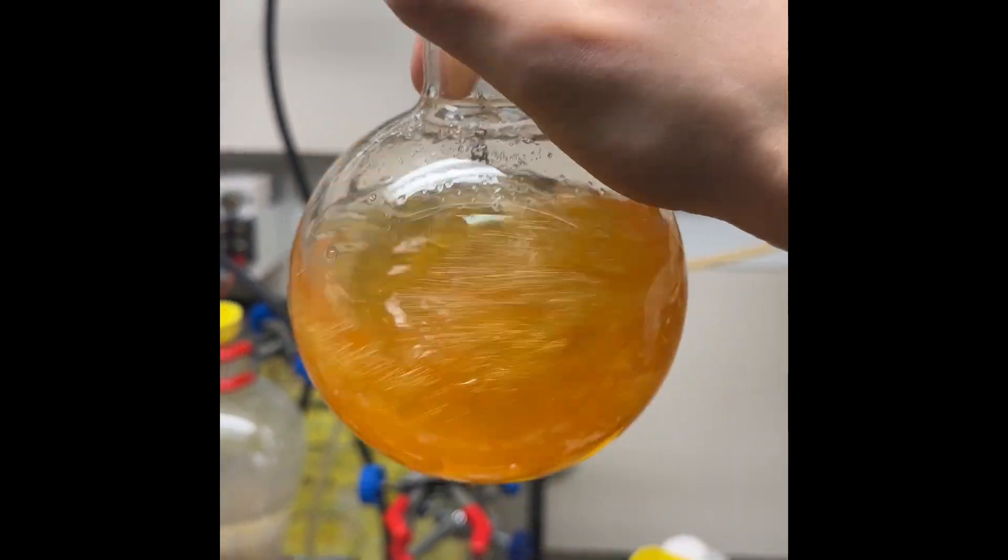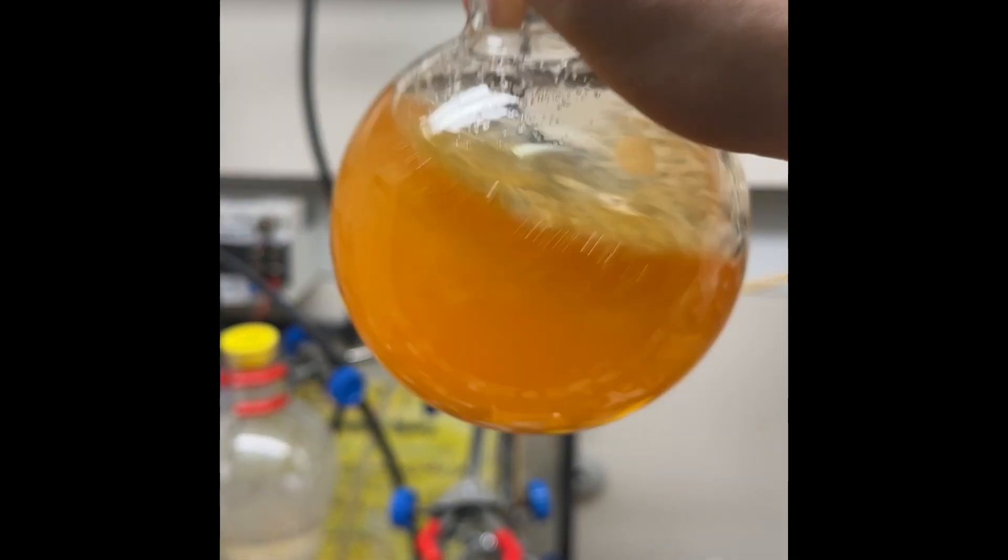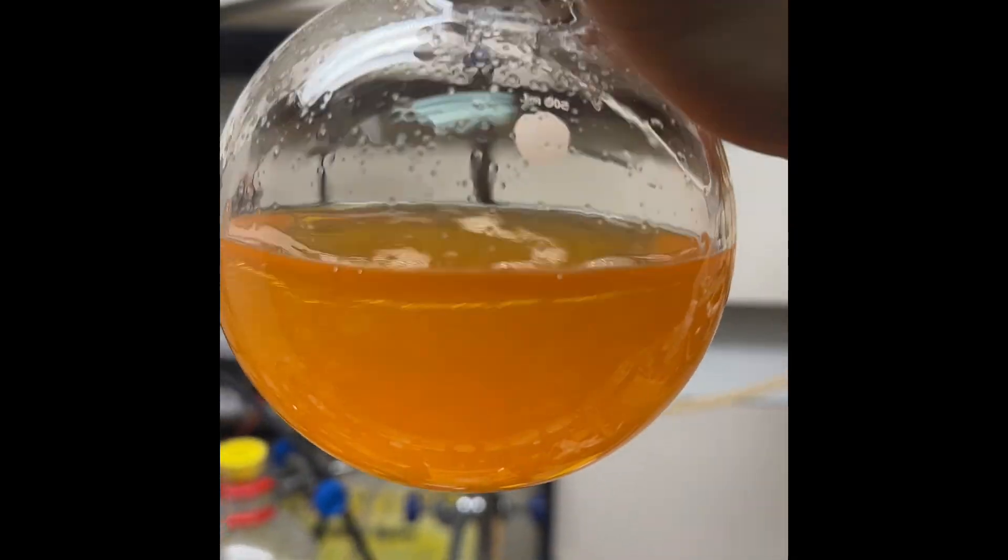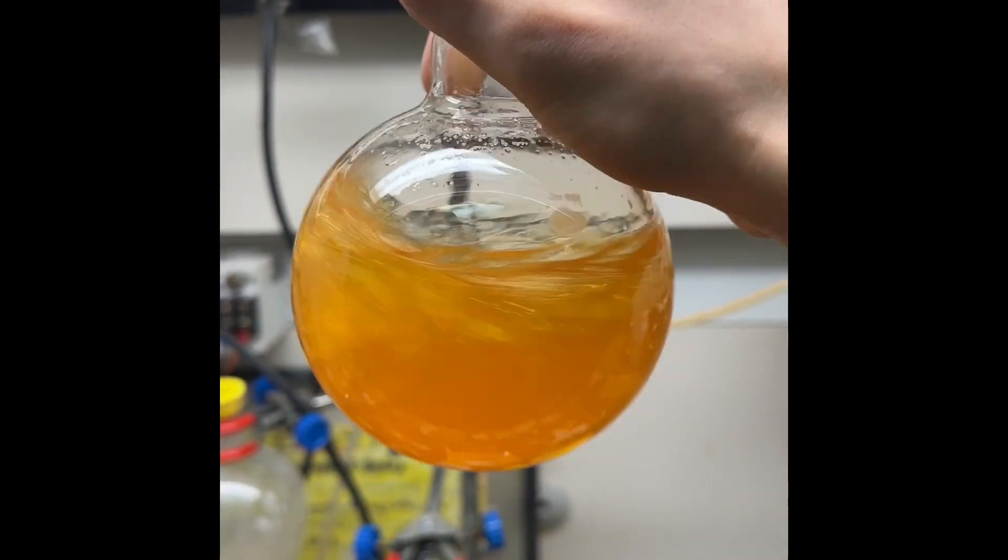Pretty much most of the bromine, if not all of it, has been reduced. The coloration left behind is just impurity in my acid most likely. You can also see sodium bisulfate crystallizing out from this as it cools down. It's only mildly warm.